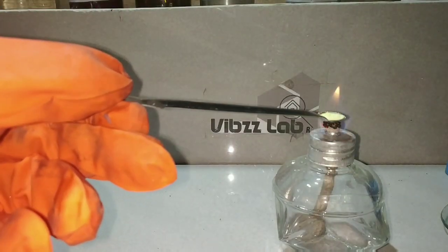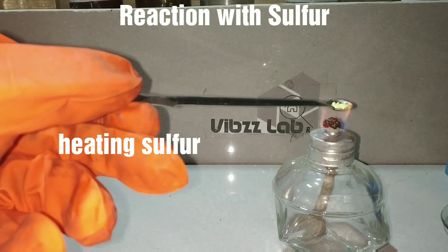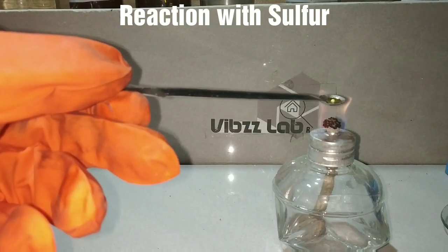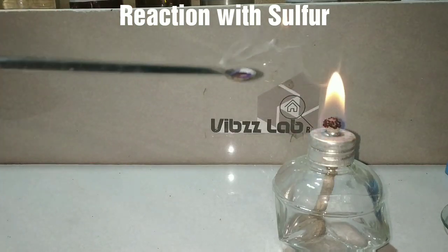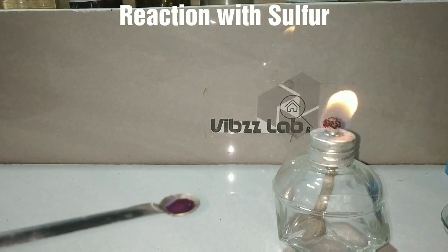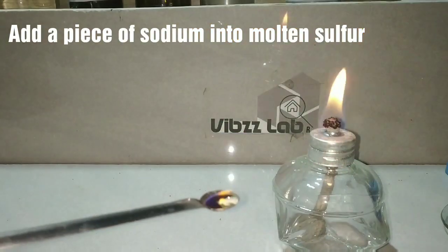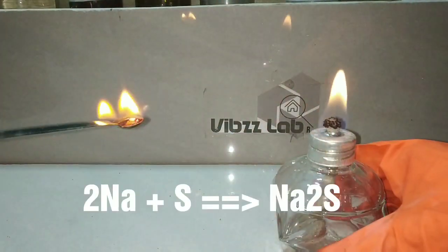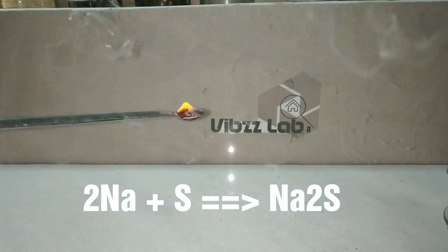Now we see the reaction of sodium metal with sulfur powder. You can see that there is some sulfur powder, which is yellow in color, in the spatula. On heating, the sulfur powder first melts and then it catches fire and burns with a blue flame. Now we add a piece of sodium metal into the molten sulfur. The sodium immediately catches fire and reacts vigorously, forming sodium sulphide.